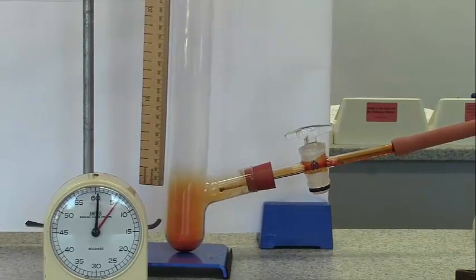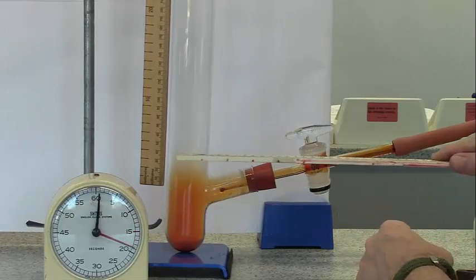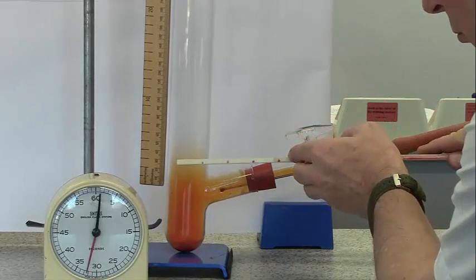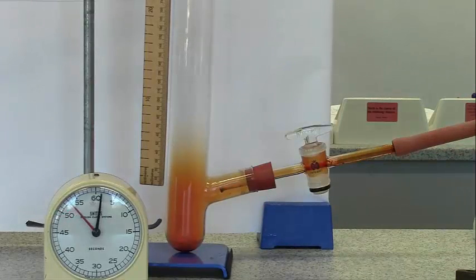You can see that the bromine is not going up by convection, because it'll start rising up. It's making very slow progress. So after 15 seconds or so, it's probably gone 3 centimetres up there. And after half a minute, it's probably about 4 centimetres. After 45 seconds, it's probably 5 centimetres. So it's making very slow progress.